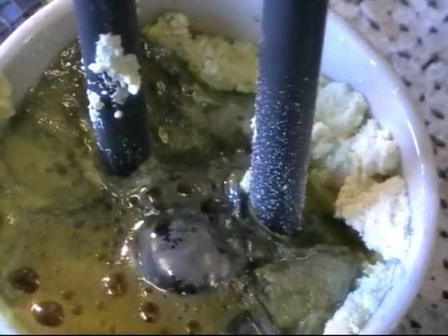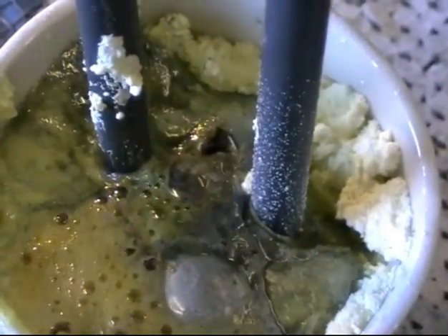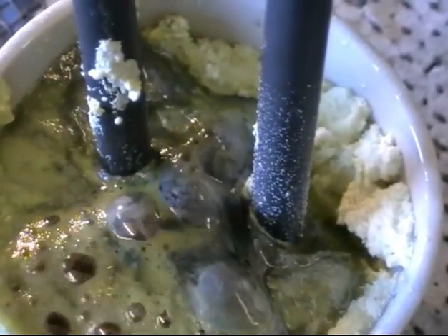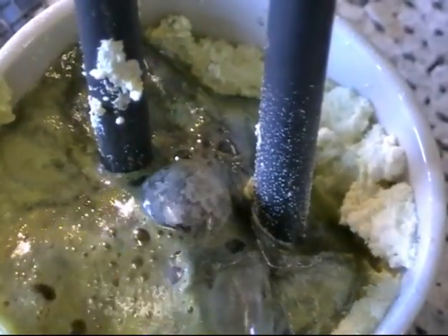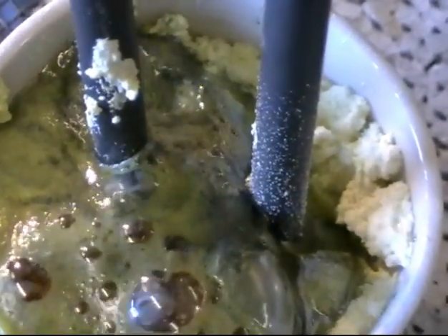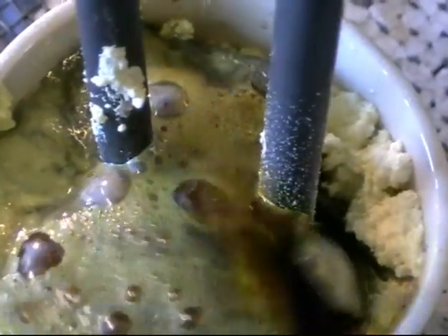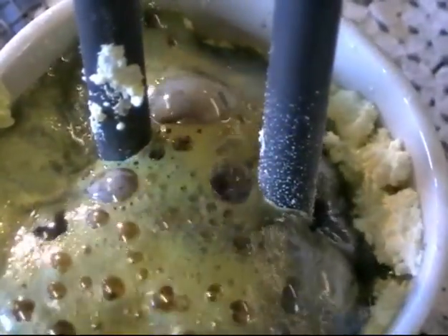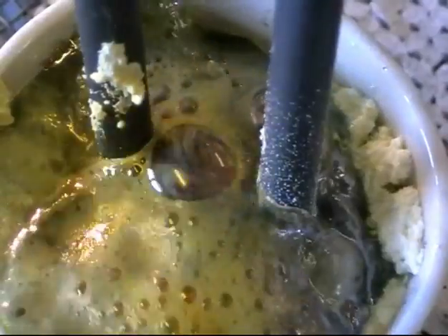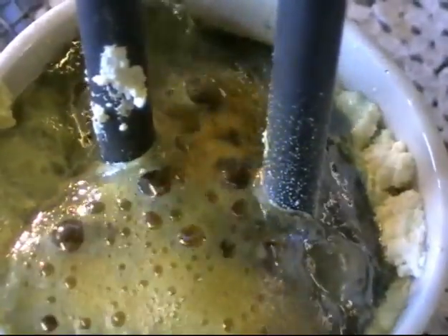So this is the electrolysis of molten lead bromide using inert graphite electrodes. You're seeing bubbling effervescence at the left hand electrode, the anode, where bromide ions are undergoing oxidation. 2Br⁻ produces Br₂, a molecule of bromine, plus two electrons. Those electrons travel up through the left hand electrode, the anode.